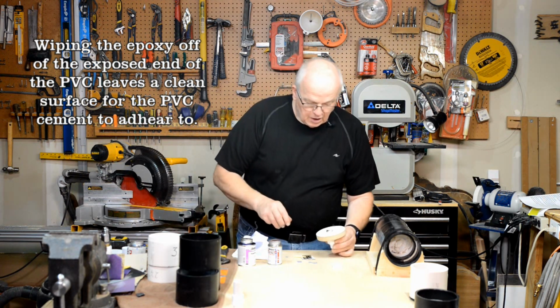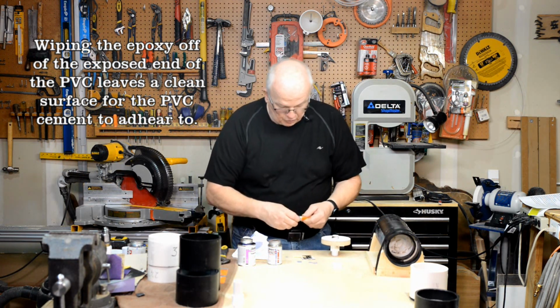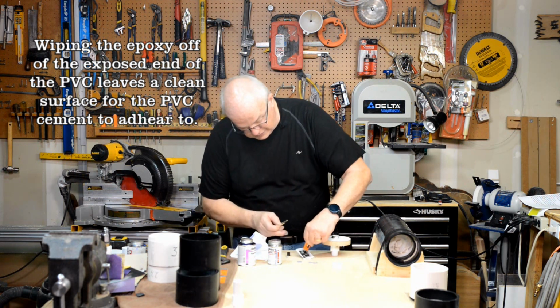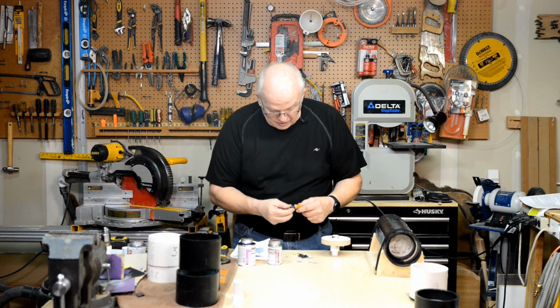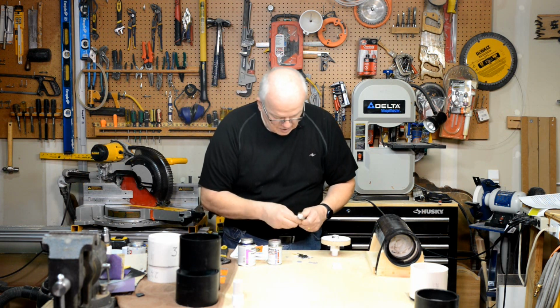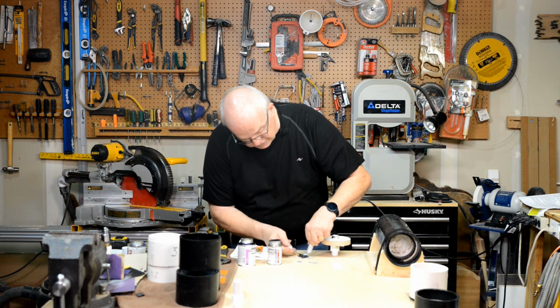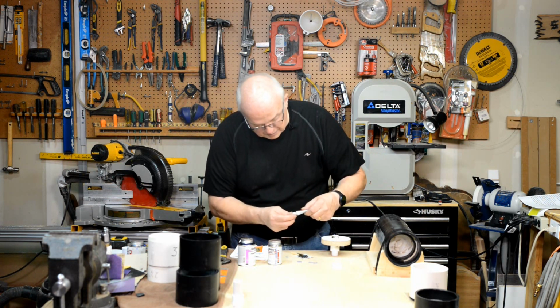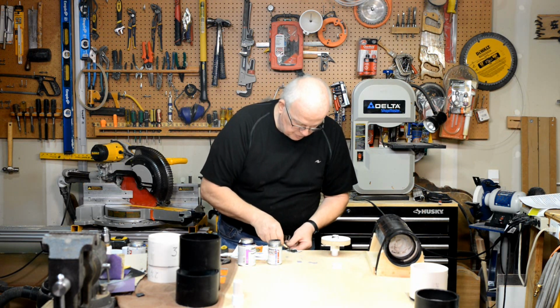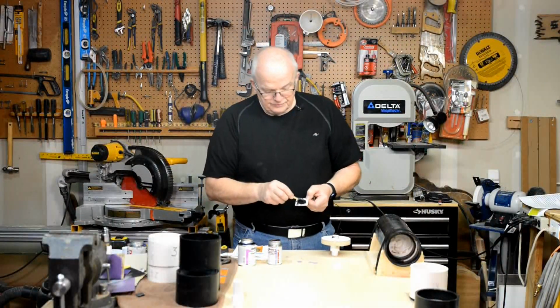Now, I'm going to have to mix a little bit more of this epoxy, and I'm going to have to be fast because this is beginning to set up already. I should have mixed enough to begin with, but I didn't. So I have time. I have a full 10 minutes, so I'm not worried about it. But I do need to mix a little bit more. I'll mix this for about a minute, and then we'll move on. Okay, it's been about a minute.